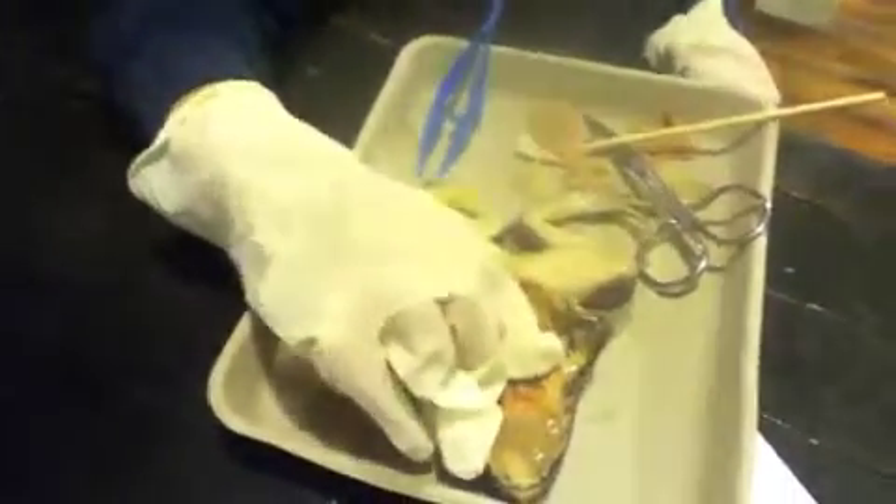And the lungs? Do you want to take some of them out? Yes, I do. Here, let's cut them off. Which ones do you want out? The spleen.